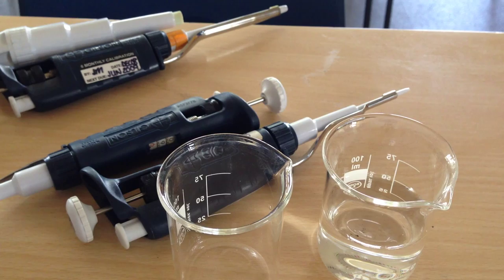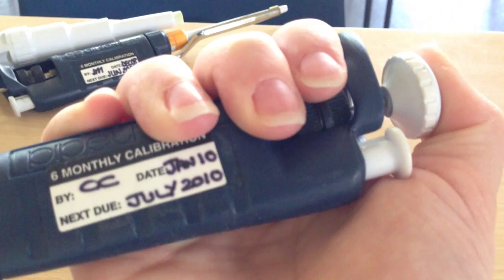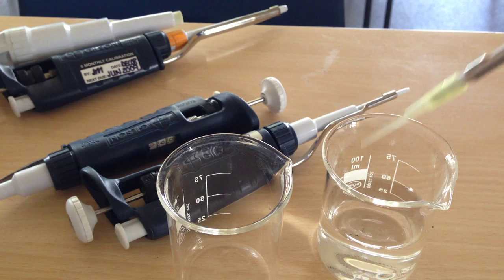So I'll just show you with the P200. Or P100. So again, what I need to do is to slowly depress the tip to the first stop, to the one stop, and then to the second stop.